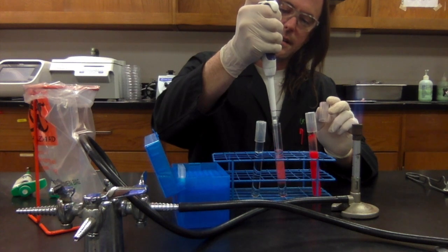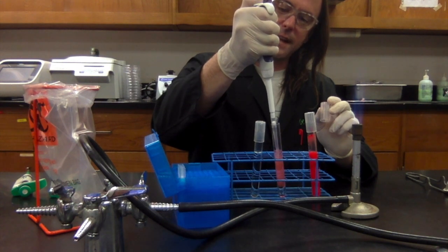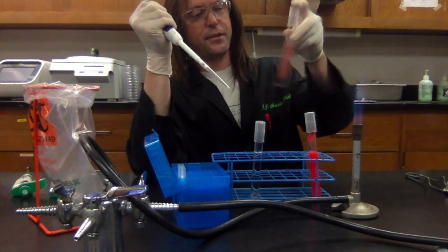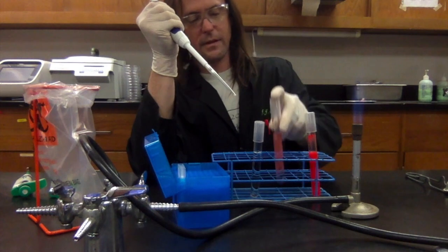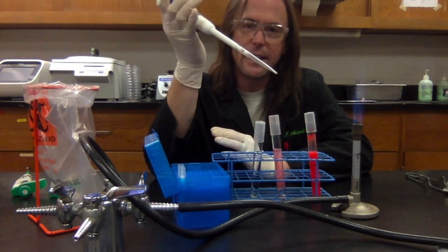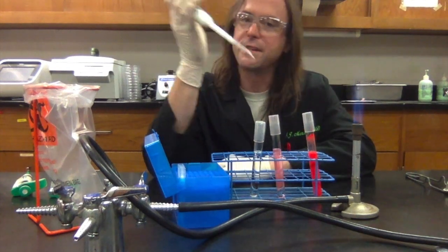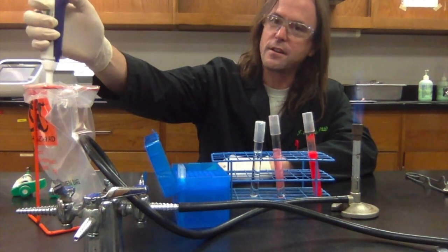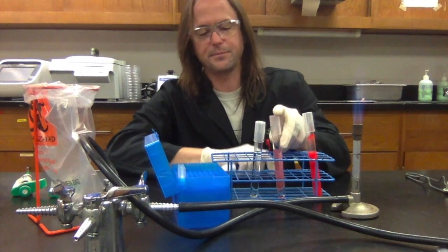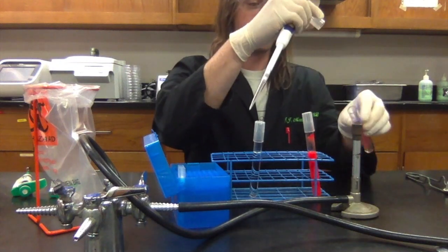Okay. Now I'm going to release the plunger, push it down again. Do it again, right? That kind of helps to mix it up a little bit. All right, so you can see that it's mixed up a little bit. And now I'm done with this pipette tip. Okay, I can't use it again. It's contaminated now with this dark red liquid. So if I use it on the light red liquid, it would contaminate it. So I'm going to get rid of it by hitting the ejector button right here, which shoots the tip into my waste bag. All right, so I'm going to repeat the whole process into the third tube.